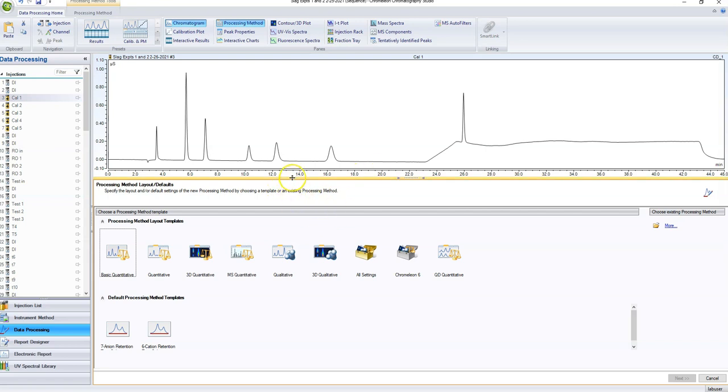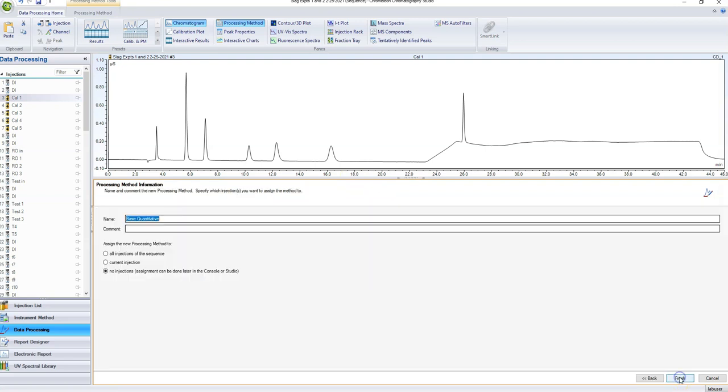So in this case, I'm going to show you how to set up a brand new processing method because there was no processing method for our data. So I'm going to click down here. I'm just going to go basic quantitative, hit next. And then, yeah, I want it to apply to all of the injections in this sequence. Let's call it anions test. Okay. Finish.